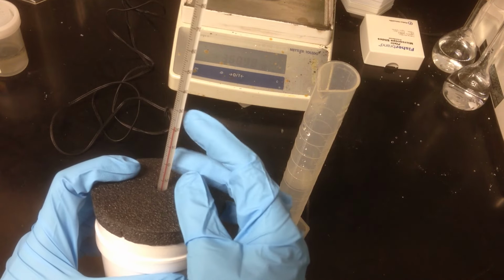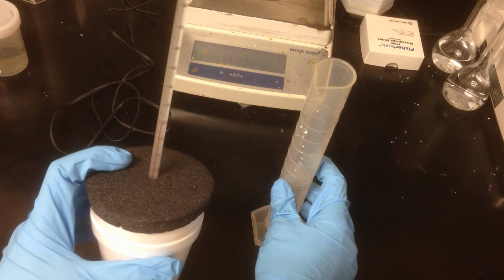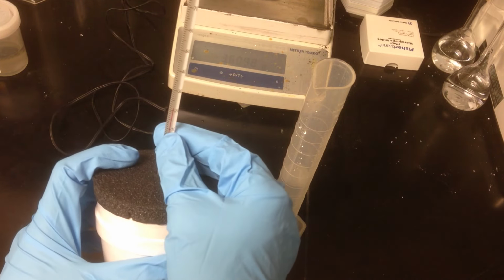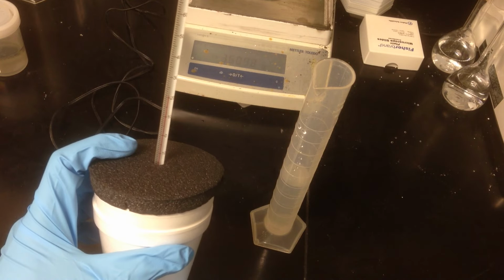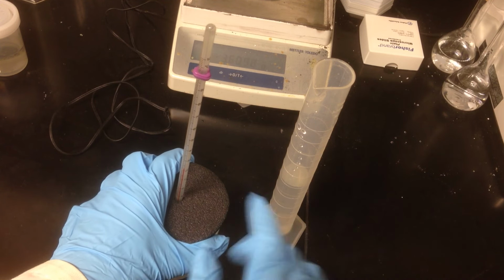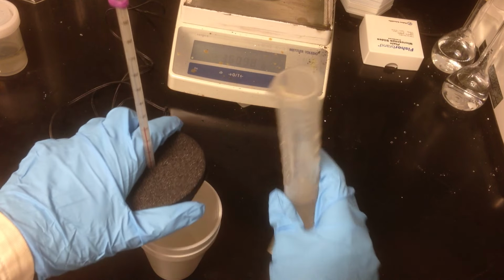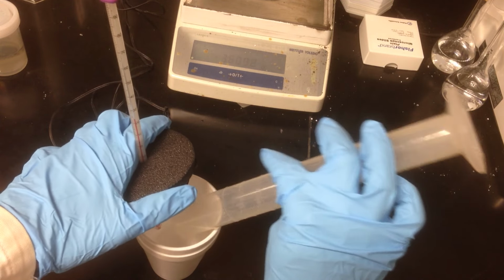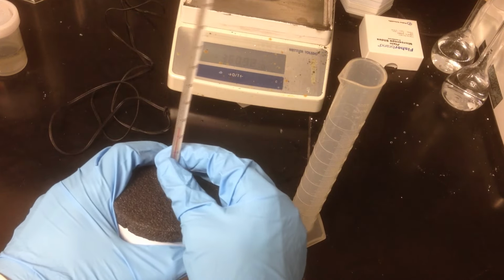So as before, we need to note the initial temperature of the liquid, and I'm going to assume that both liquids are at the same temperature because they're both at room temperature. So using this thermometer reading, which looks to me to be again about 21.2 degrees Celsius, we can use that as our initial temperature. And as before, we're going to mix these and look for the maximum temperature achieved by the reaction solution. So I will quickly pour in the acid solution and replace the lid and swirl things around a little bit.